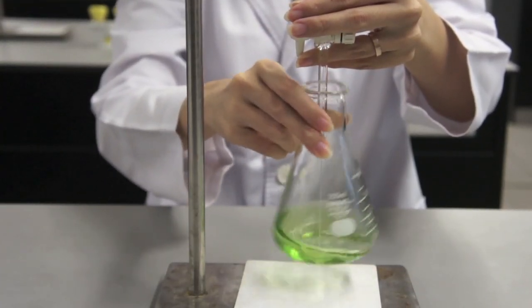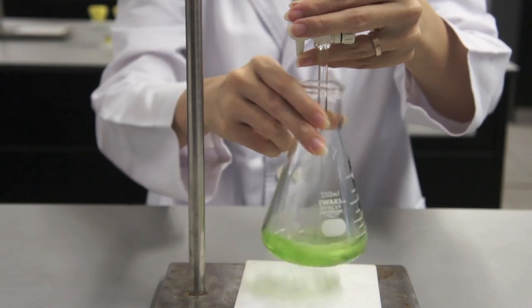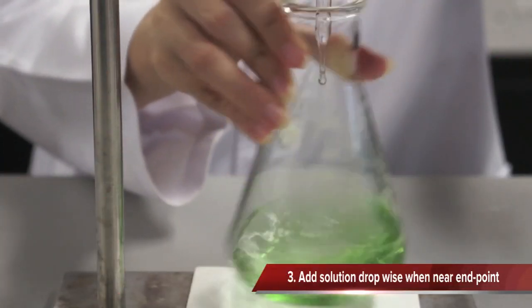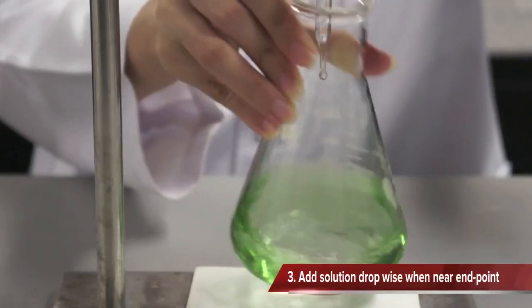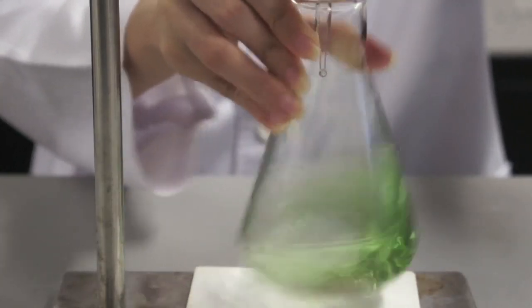Continue to add solution from the burette until you are near the end point. When you are near the end point, slow down the titration by adding the solution drop-wise.